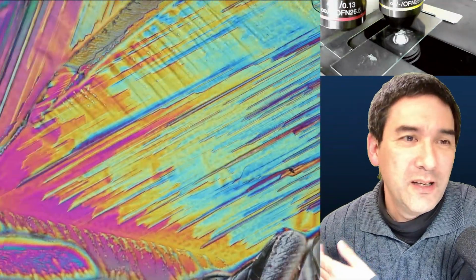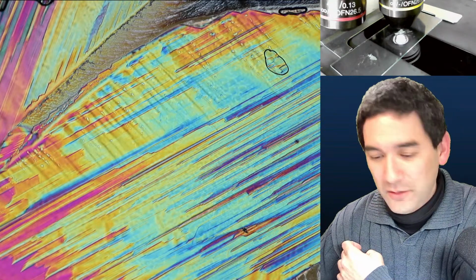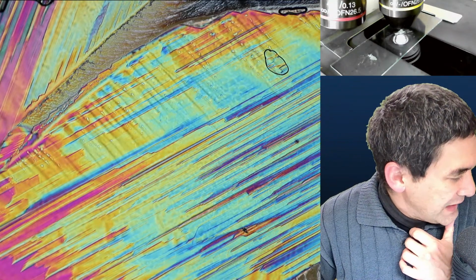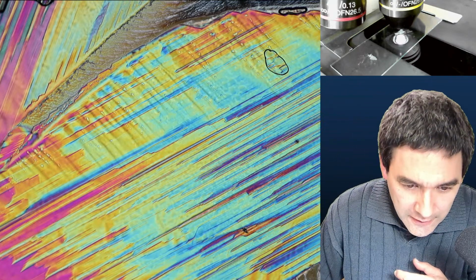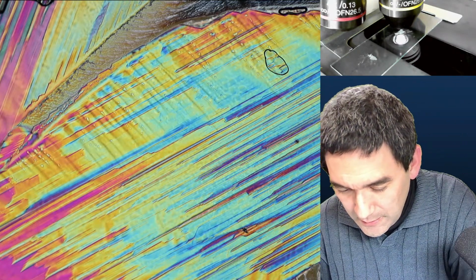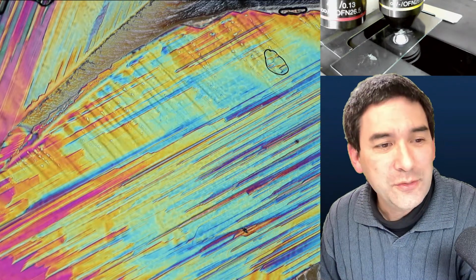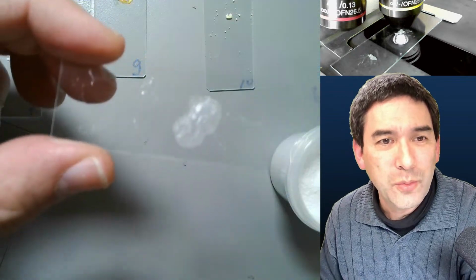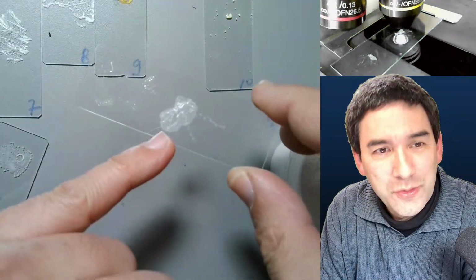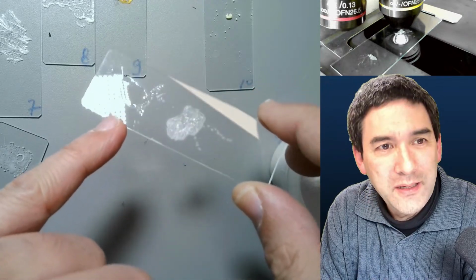I love these things here. I mean, they look very pretty. So this was now what number? This was now citric acid, tartaric acid. Number 5. Where is number 5? Do I have number 5, 6? No, here it is. Okay. Look, also quite an interesting thing here, and I made this slide 12 hours ago. Look, over here it crystallized. And over here, it remained wet.